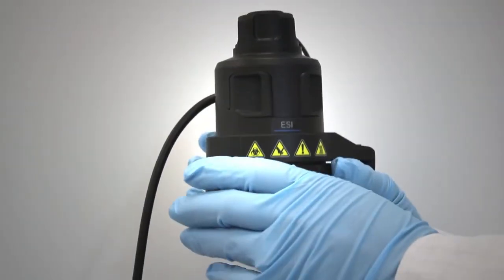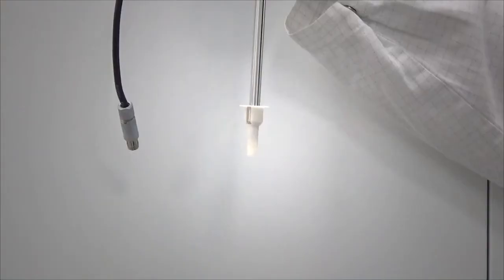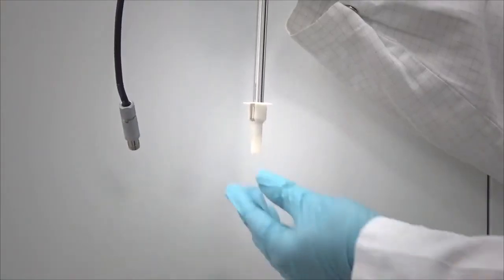Squeeze the probe adapter cap release buttons and then lift the cap off of the probe adapter. Remove the protective cap from the probe tip.